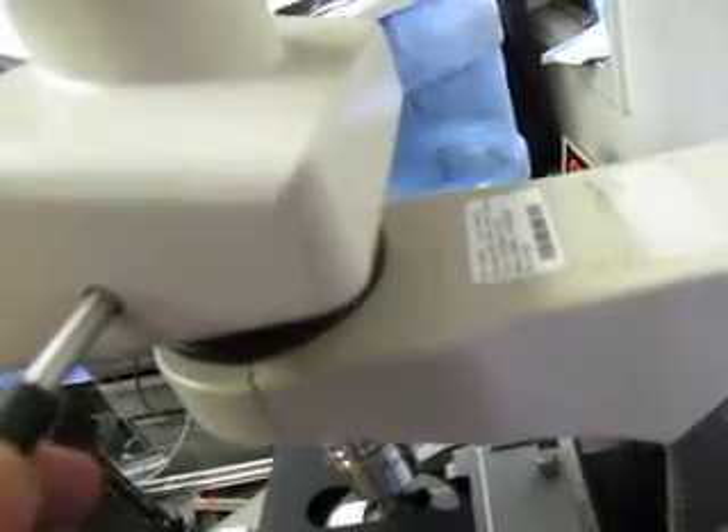Let's see what works. This goes back and forth — the stage — as well as this part of the stage goes back and forth. This has got something to do with photos, I think. You can look through it and it changes the hole, or the amount of light you can see through this. This has got a filter on it, this piece here.